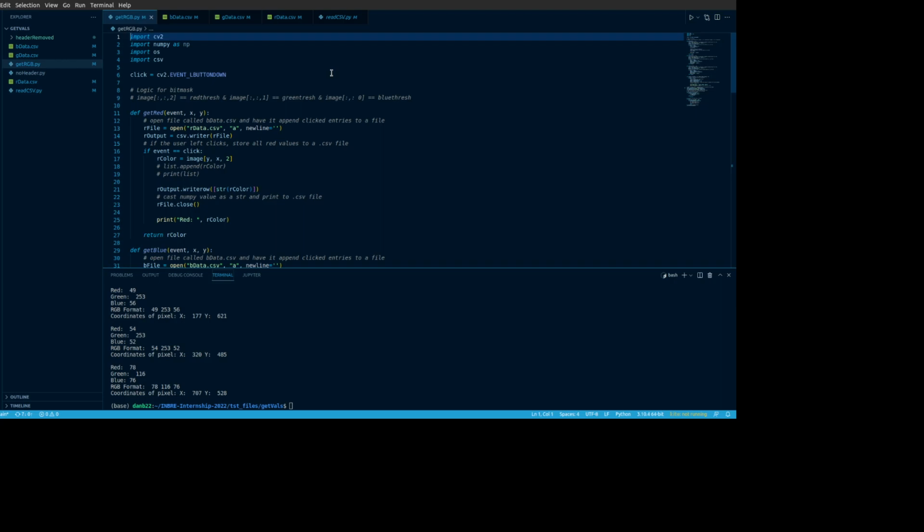That end calculation variable will plug back into the threshold logic from the cell counter program that's already been discussed in a previous video. That will be approximately what your threshold should be for that particular research, and start counting the cells the same way my program does right now in terms of the zebrafish image. Of course, this will have other implications where you, as the user, maybe have a little bit more manual control. You can come in and edit the program if you're savvy that way and change the value if the threshold seems to be just a hair off.